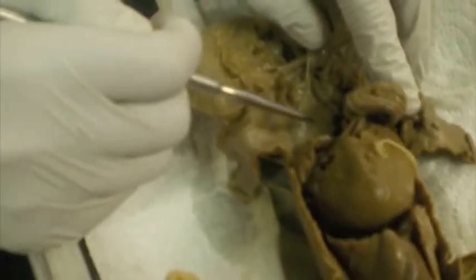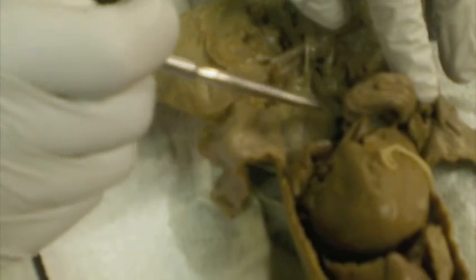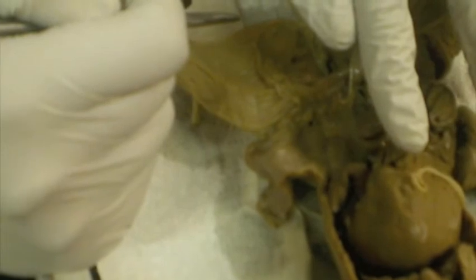So with the kidney, two major blood vessels flow in and out of it, the renal artery and the renal vein. The renal artery branches out from the abdominal aorta and enters into each kidney. The renal artery supplies kidneys with blood, which is then filtered out by the kidneys. Now, the renal vein is located anterior to the renal arteries at an almost 90 degrees to the vena cava. The renal veins are the blood vessels that carry deoxygenated blood from the kidneys to the inferior vena cava.